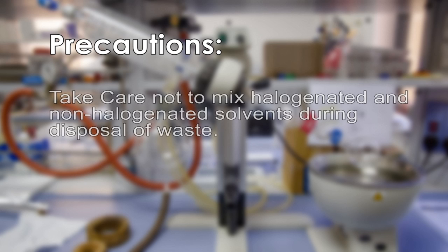Take care not to mix halogenated and non-halogenated solvents during disposal of waste.